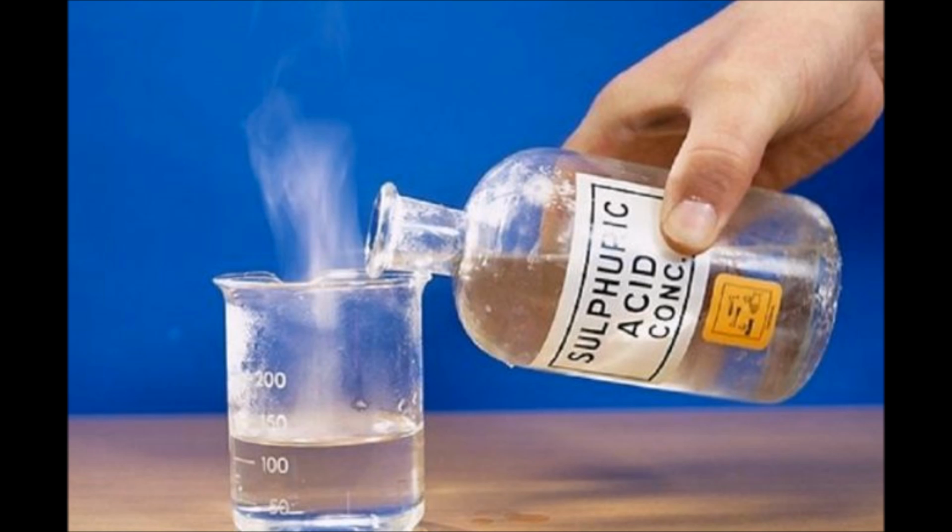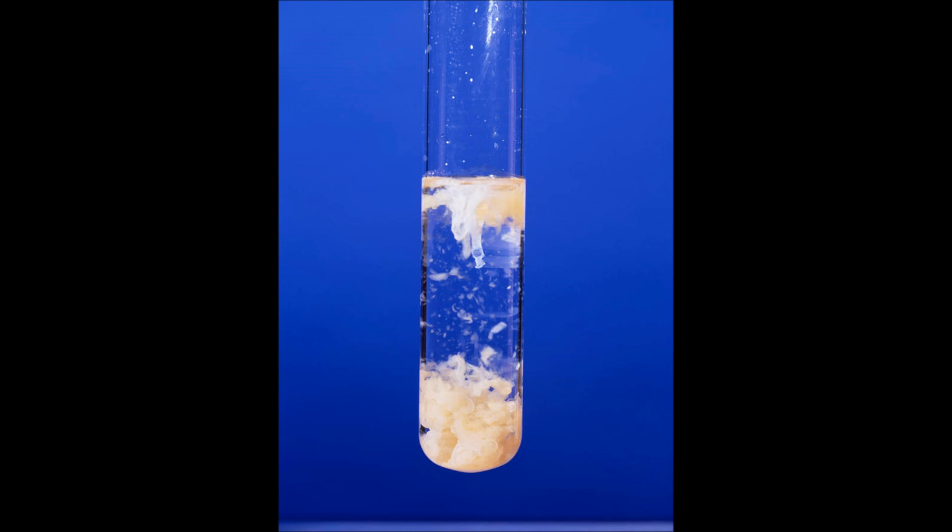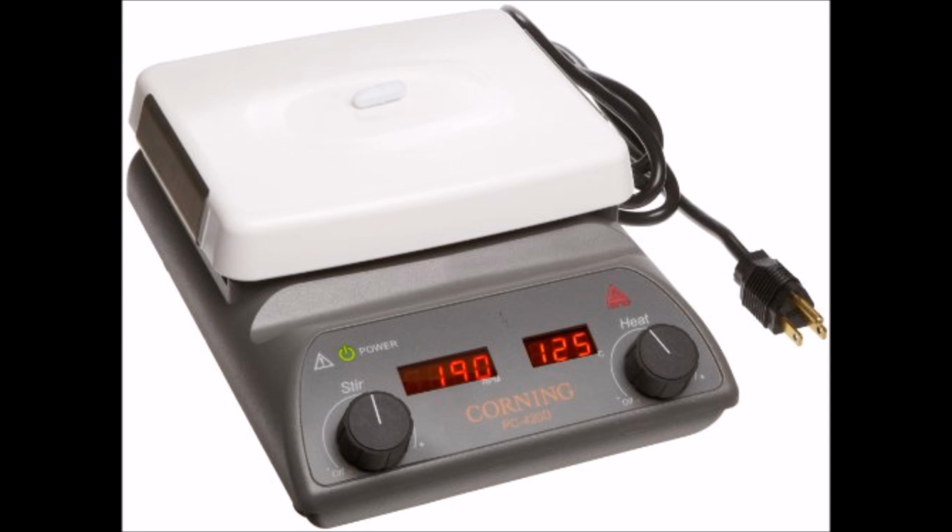The second step is adding 25 milliliters of sulfuric acid, which causes the aluminum hydroxide to precipitate out. Then, another 25 milliliters of sulfuric acid was added, which was meant to neutralize the hydroxide and allow it to dissolve into the solution. Initially, the solution with 50 milliliters of sulfuric acid did not dissolve all of the hydroxide. Therefore, the solution was heated on a hot plate until the solution was clear and colorless. This signified that all the hydroxide was dissolved.